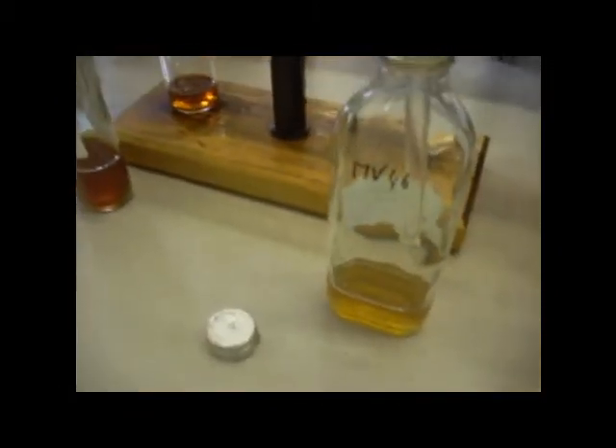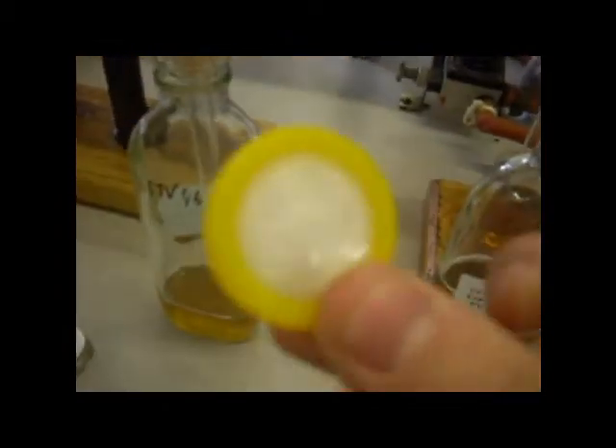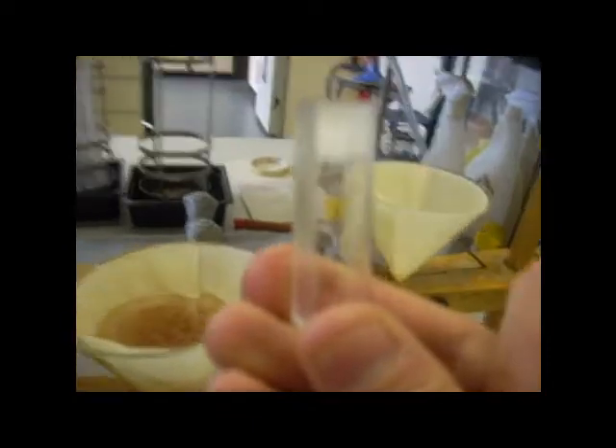When we take a photo spectral analysis, we're going to put the beer through another filter and then into this capsule that will be read by this machine here. You can see it's actually reading a few different beers in there already.